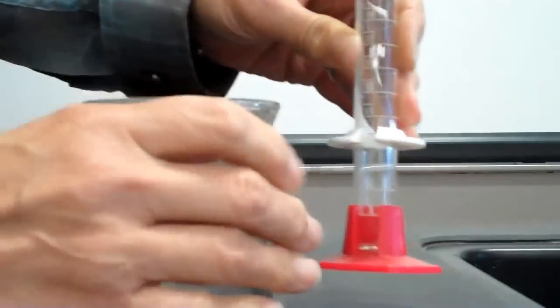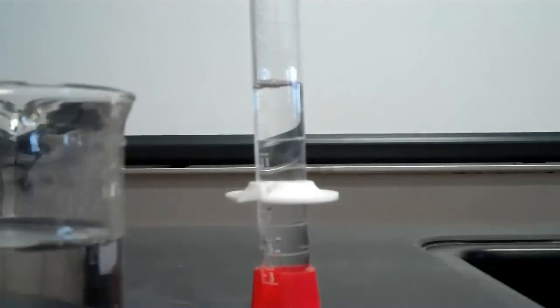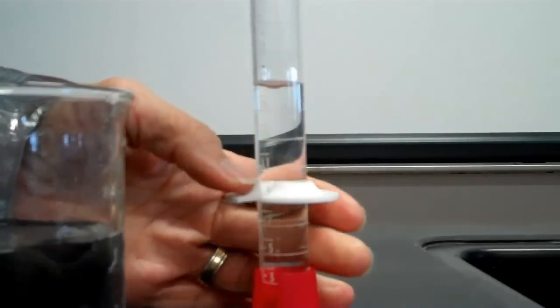First I'm going to pour the water in, and as you can see, I went way over the 10 milliliter mark, which is here.